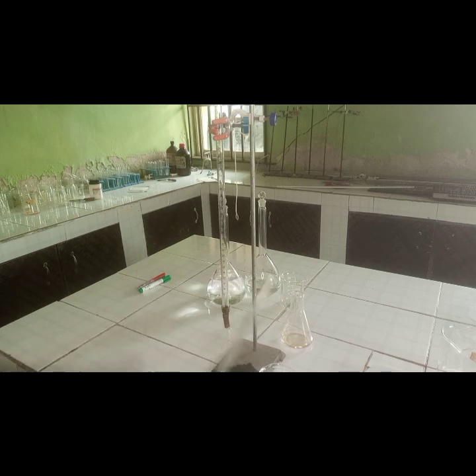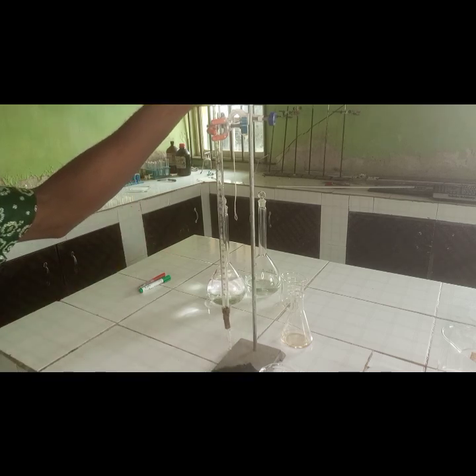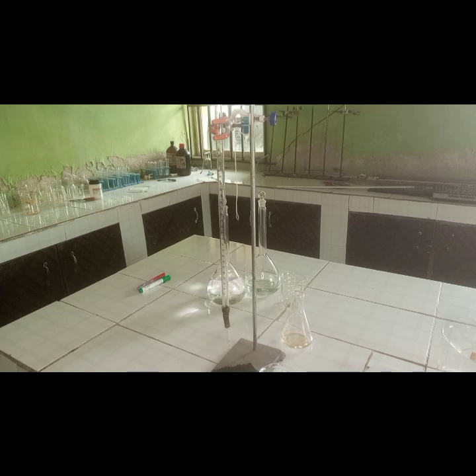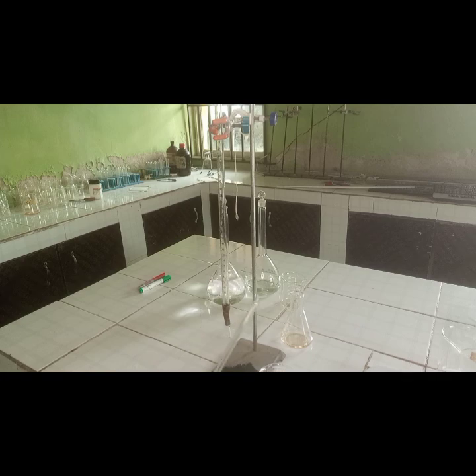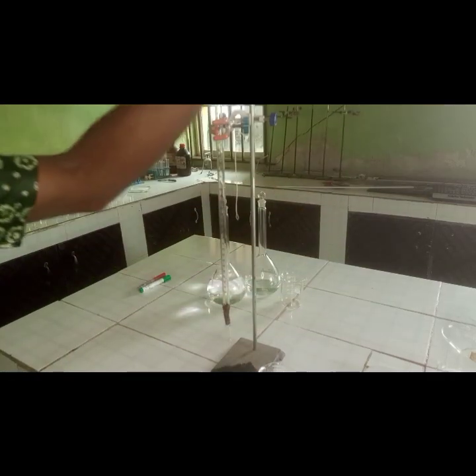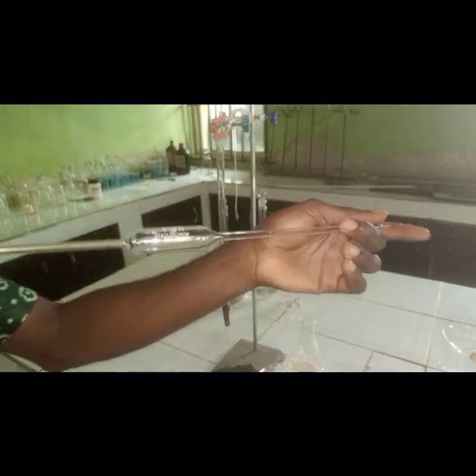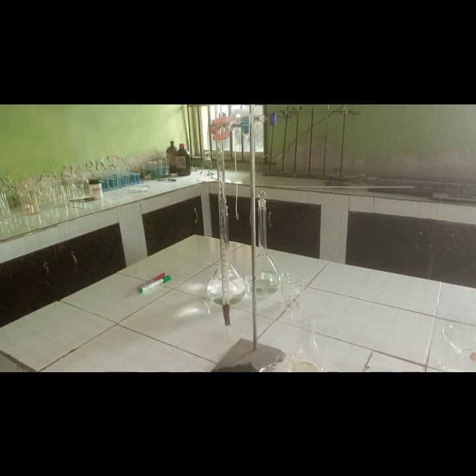So then you rinse this with the solution it's meant to contain. You have to rinse this. That is part of the procedure or precautions you need to take. You need to rinse the burette with the solution it's meant to contain.